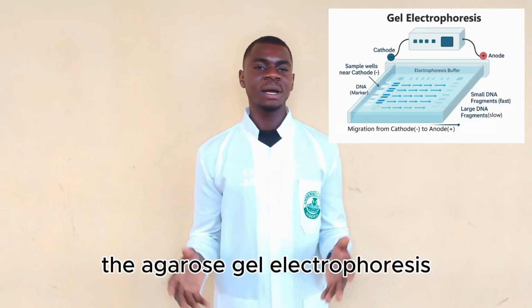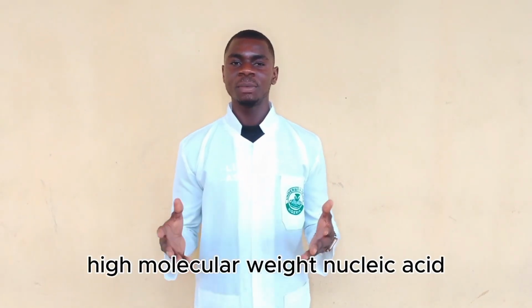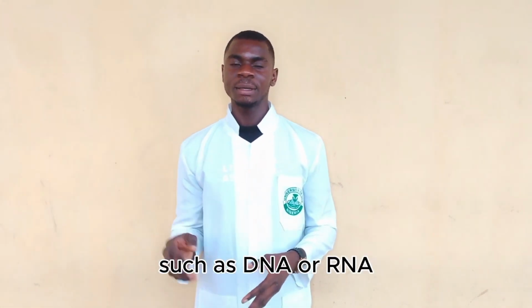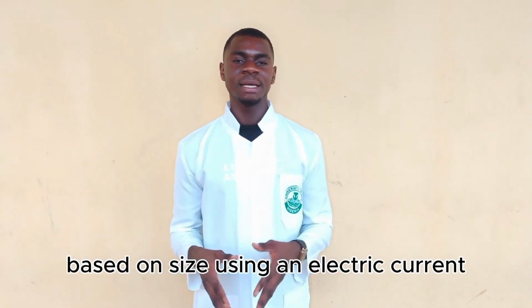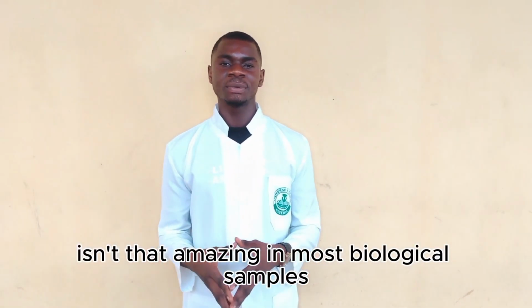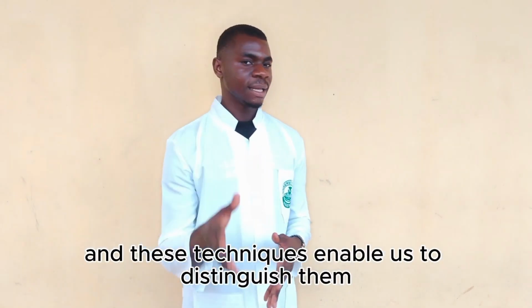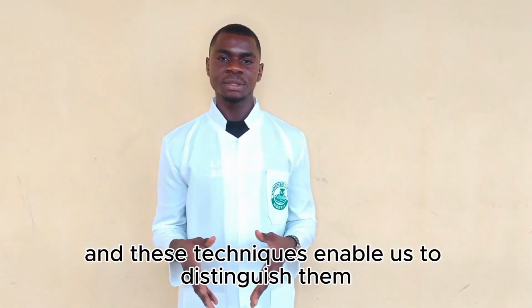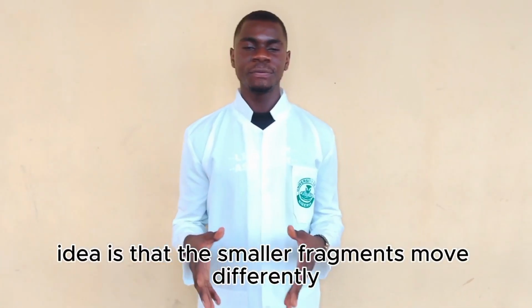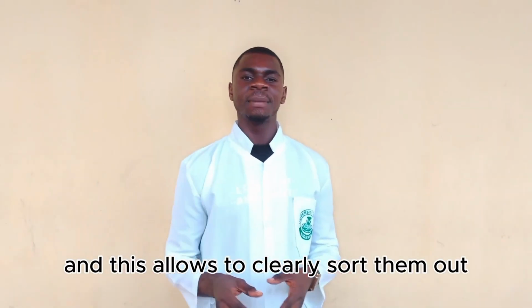I will be talking on agarose gel electrophoresis, giving a simple conceptual overview. Agarose gel electrophoresis is a technique that is used to separate high molecular weight nucleic acids such as DNA or RNA based on size using an electric current. Isn't that amazing? In most biological samples, nucleic acids exist as fragments of different lengths, and this technique enables us to distinguish them. The key idea is that the smaller fragments move differently compared to the larger ones, and this allows us to clearly sort them out.